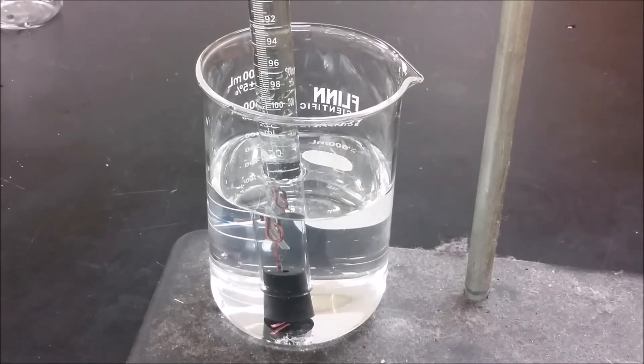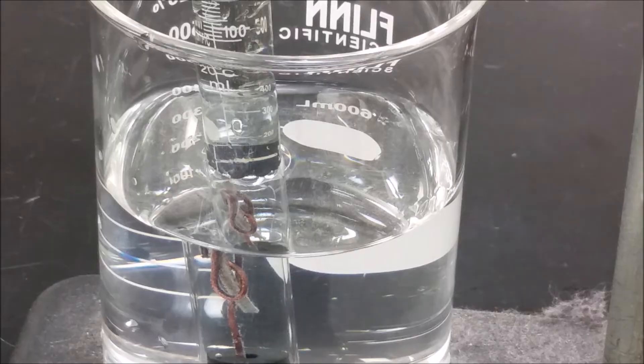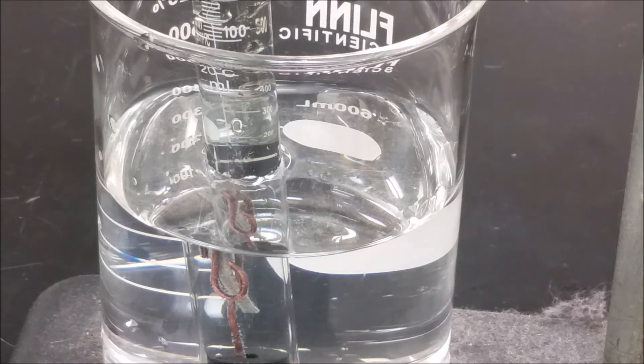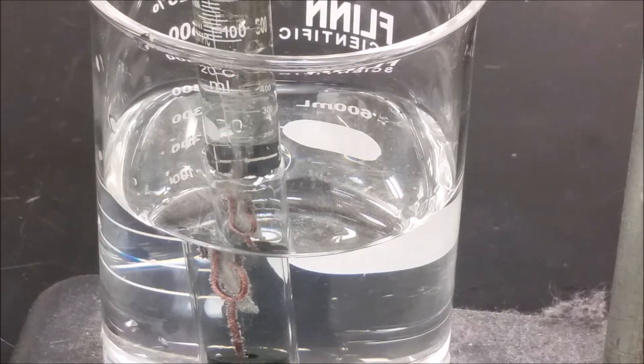Since you have an excess of hydrochloric acid you can see that this is going to actually start to react faster and faster. Right now we're at the beginning - you can see a little tiny bit of bubbling where the magnesium ribbon is - but that bubbling is going to pick up more and more as you see that red color shift down towards the bottom.